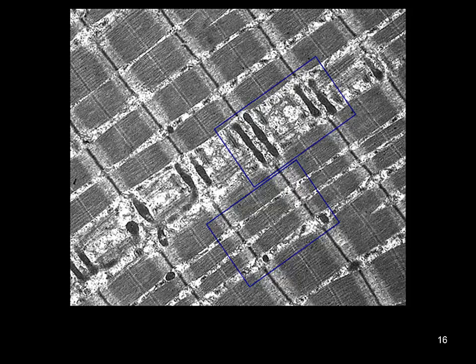So now shifting gears to the EM level, we can see the banding pattern that we've come to appreciate in the A band, the I band. There's our Z line. Right in the middle we have the pale H band and the dark M line right down the middle. Here we're sort of between, going out of the plane of section, we can see some sarcoplasmic reticulum. Got some elongated mitochondria in here. We can't really see T-tubules at this level, but we'll look at those as we go a little bit higher magnification.